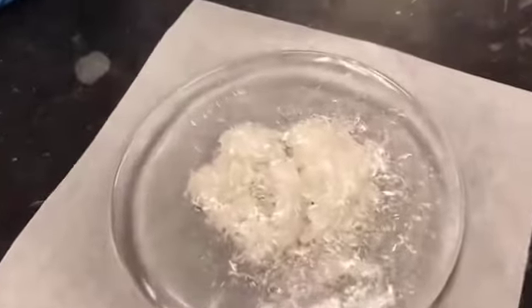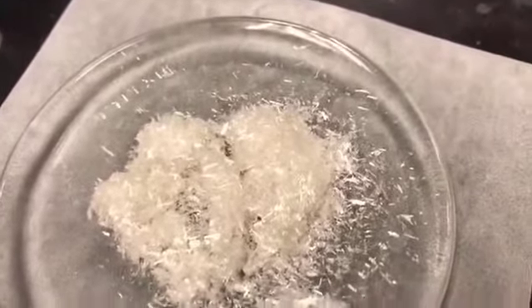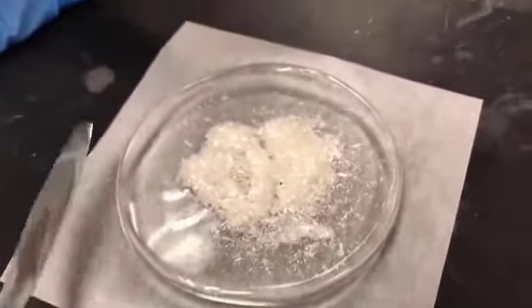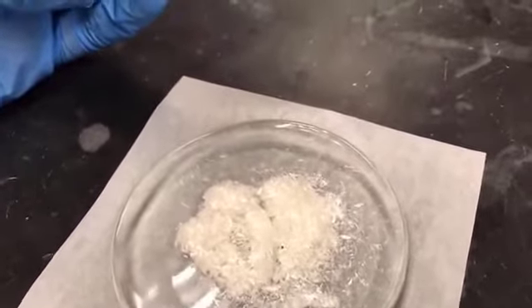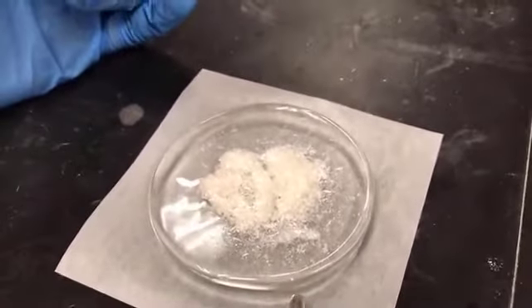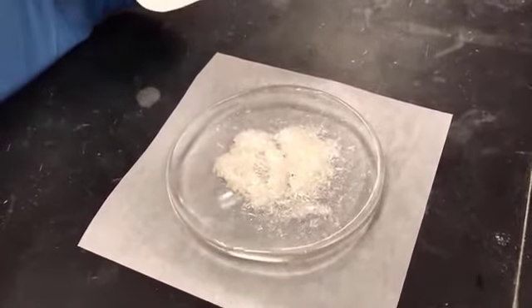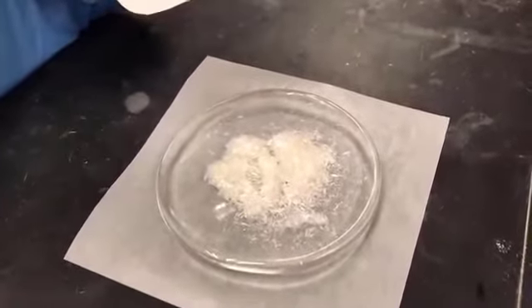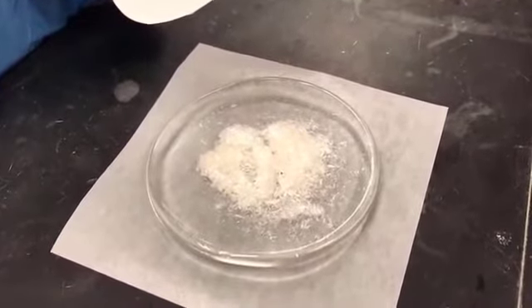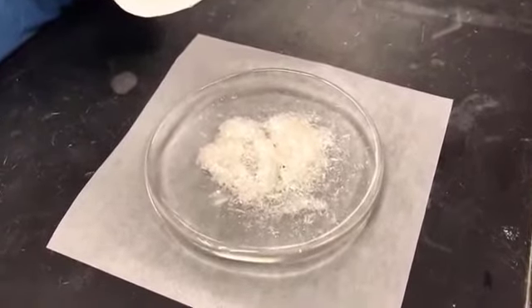They are fine needle-shaped shiny crystals. To avoid having crystals around and to keep all the crystals on the watch glass, it's good to have a butter paper below the watch glass. So whatever crystals fall around it, you can recover them by adding them to the watch glass. That way you will not lose much of your sulfanilamide, or any compound which you are crystallizing.